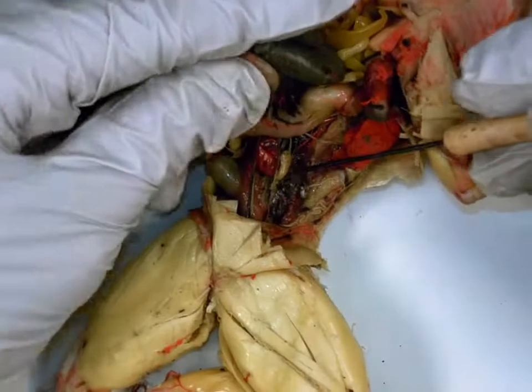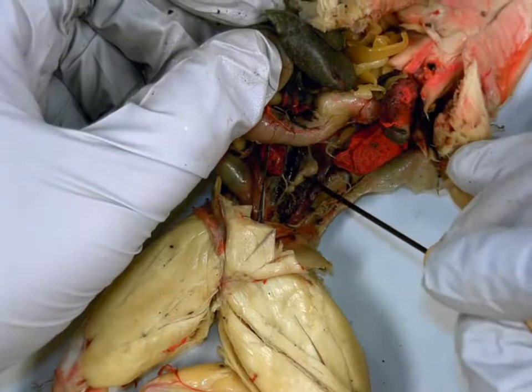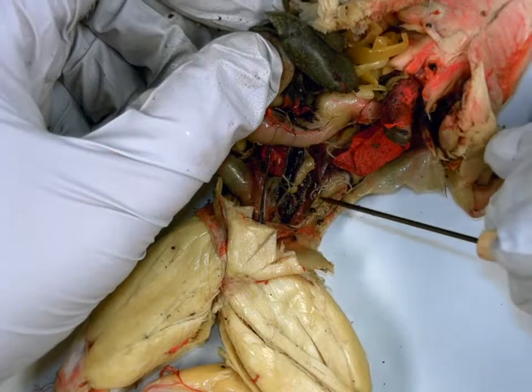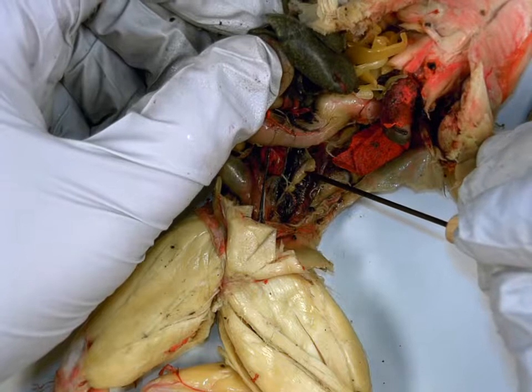Now here would be the kidney on this side. You can see there's a kidney here, dark, and a kidney on the other side. But sitting on the kidney is this little kind of creamy colored round organ. What is that? Testes. Function of these testes? Produce sperm and male hormones.